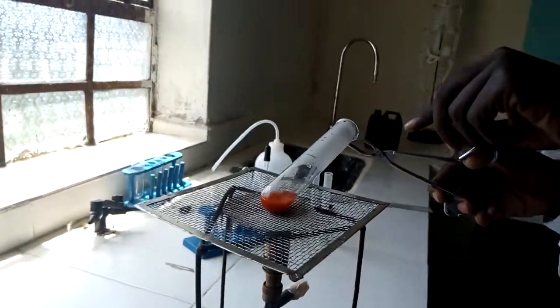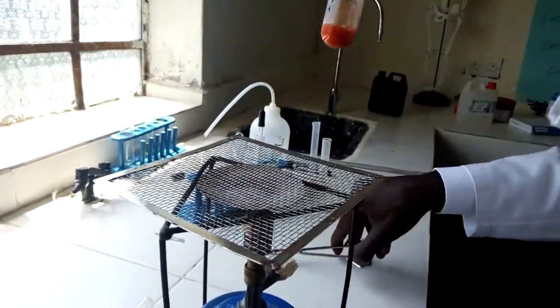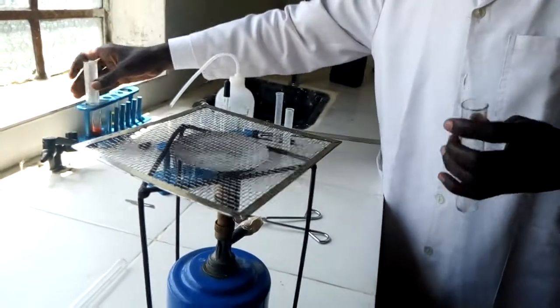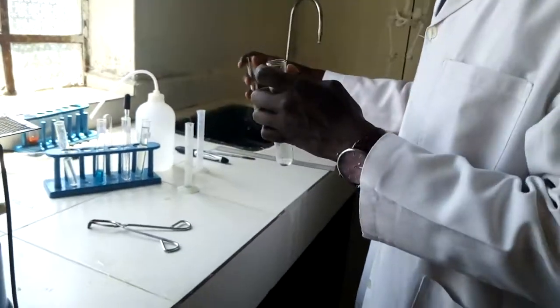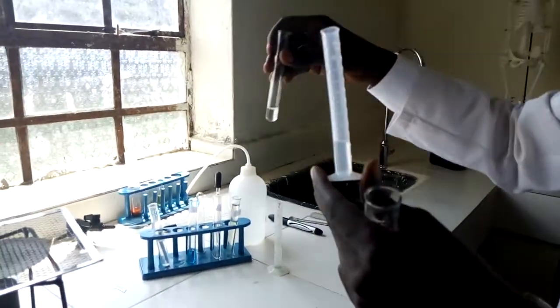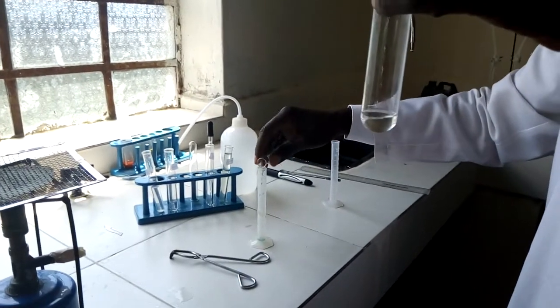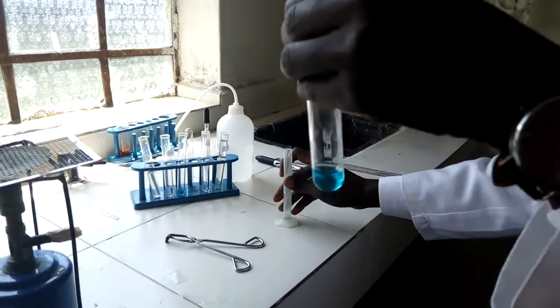I also want to conduct another experiment whereby I'm going to take a negative test of the same so that we can see how it's going to be. We're going to see the color change and what's going to happen to the colors over here. I am just starting, just as usual. I started by putting 2 centimeter cubed of the substrate to be tested. Let me just measure 2 centimeter cubed. There we go. 2 centimeter cubed into a boiling tube. I'm going to add 2 centimeter cubed of Benedict solution. Let me just measure the 2 centimeter cubed of Benedict solution. There we go. So I'm going to heat this one to boil.